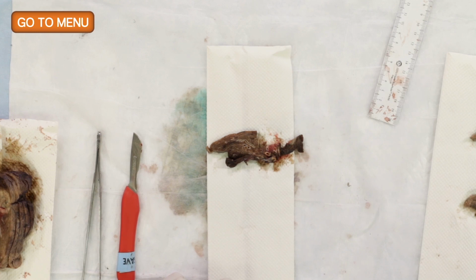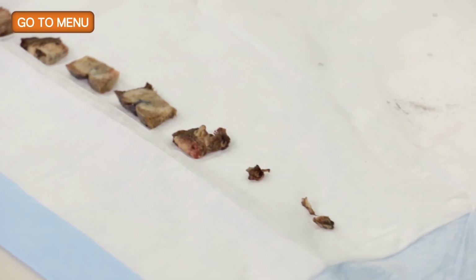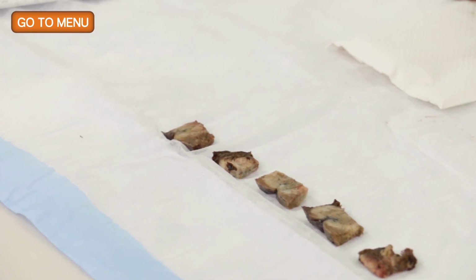So now we've addressed the tumor, and so we've taken our sections and shown the relationship for staging, measurements, and pleura. And we also have our sections for heterogeneity so that we can assess the different histologic types. Yes. So what do we want to do next?